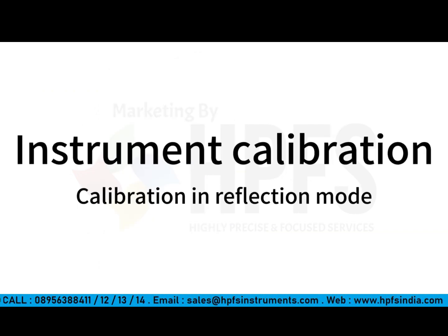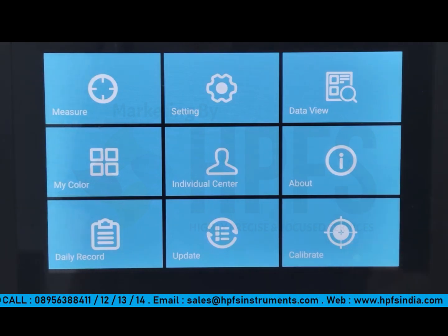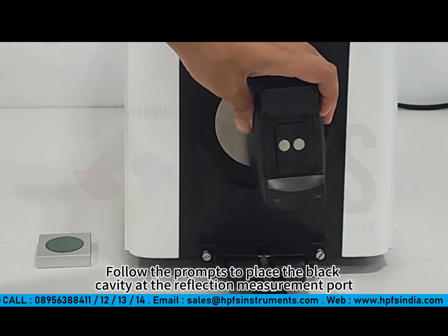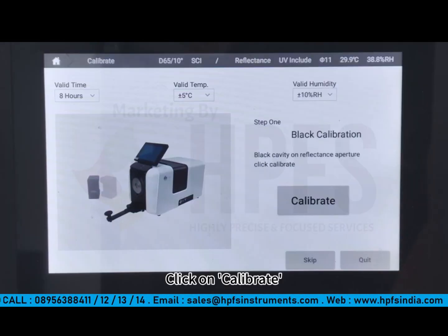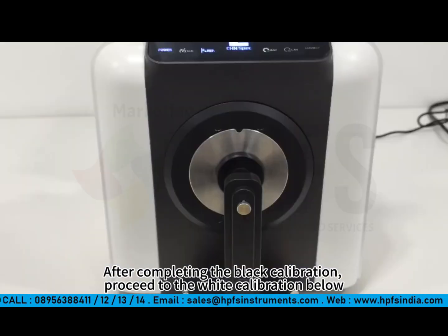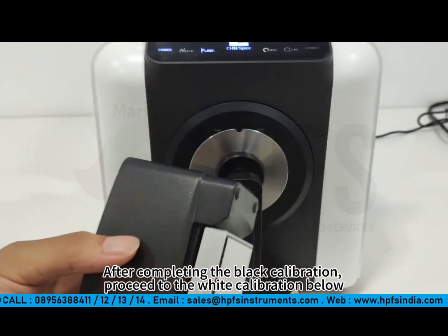Instrument calibration. Calibration in reflection mode. Click on Calibrate on the screen. Follow the prompts to place the black cavity at the reflection measurement port. Click on Calibrate. After completing the black calibration, proceed to the white calibration below.